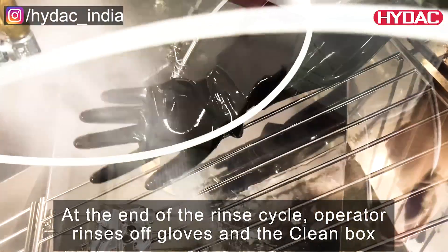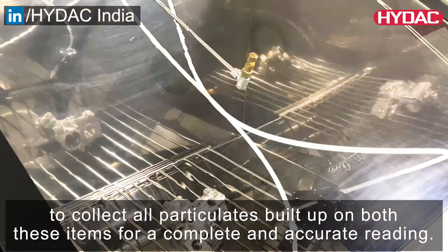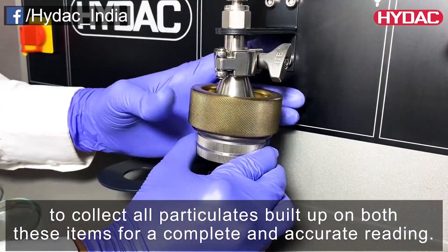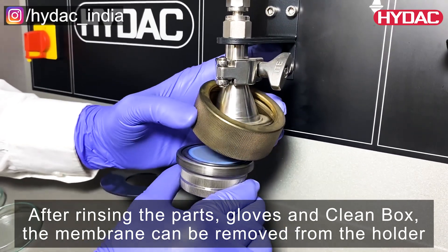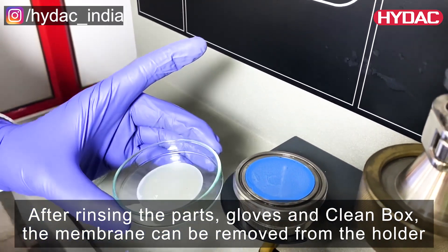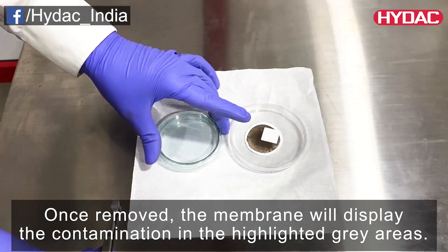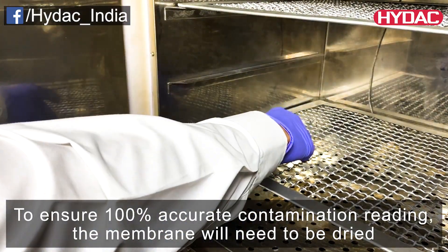At the end of the rinse cycle, the operator rinses off the gloves and the clean box to collect all the particulates built up on both these items for a complete and accurate reading. After rinsing the parts, gloves, and the clean box, the membrane can be removed from the designated holder. Once removed, the membrane will display the contamination in the highlighted grey areas.